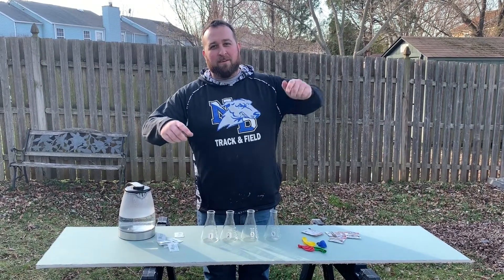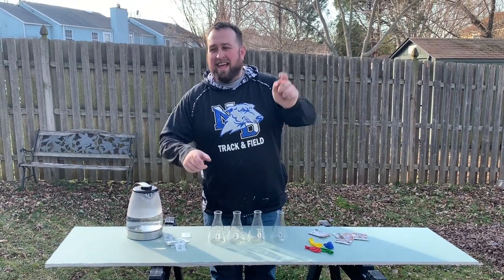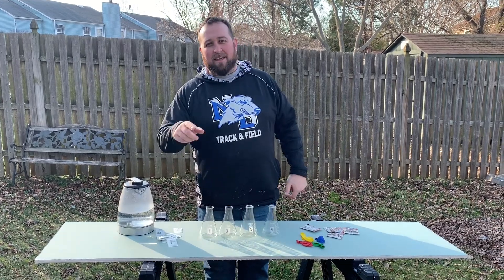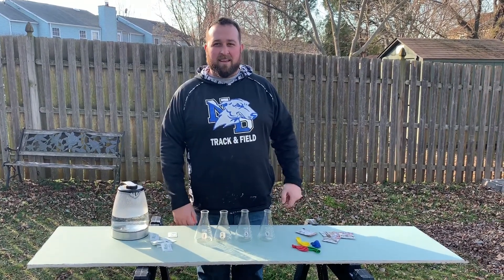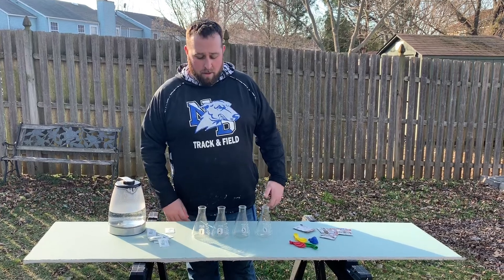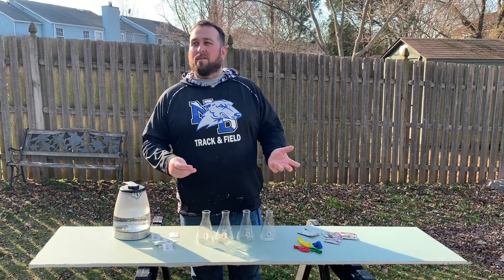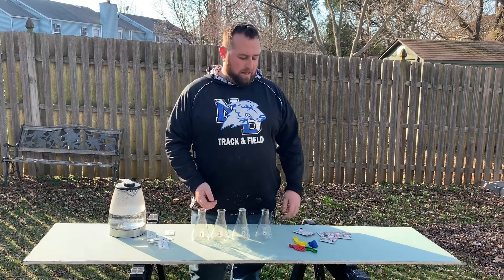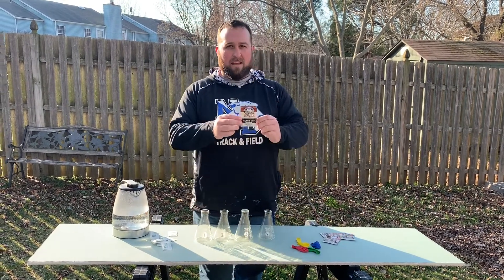This is another edition of Welcome to Science with Mr. V. We're in the lab, but on location today in my backyard, doing a little remote learning. We want to know: what do organisms do with the food that they eat? We're going to study that with these little guys known as yeast.